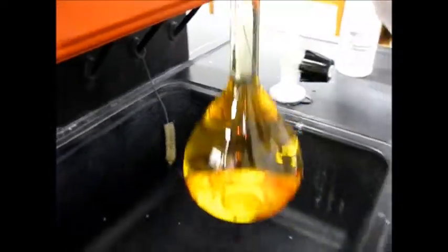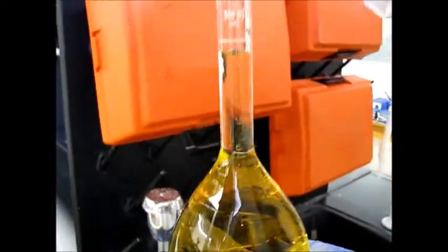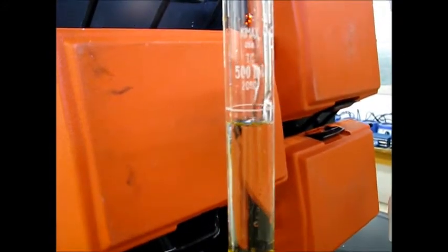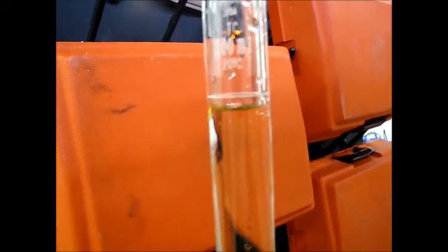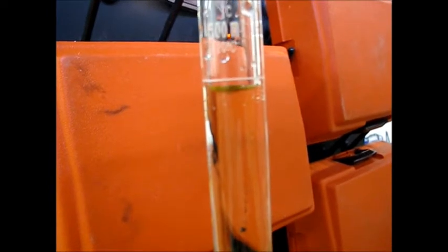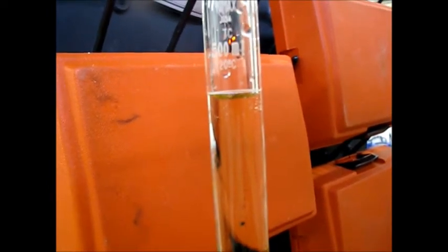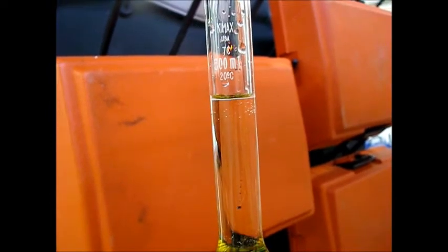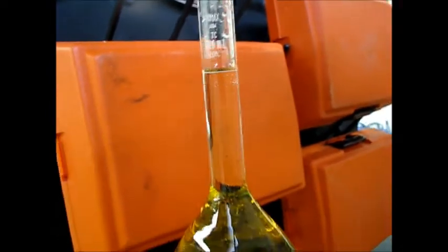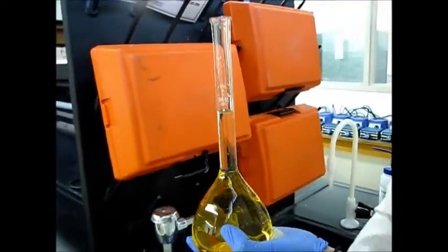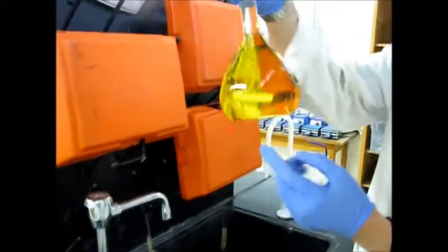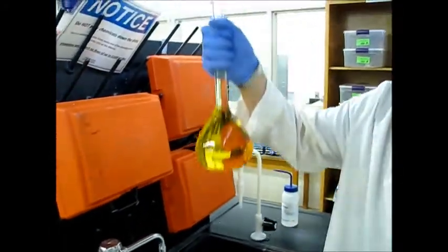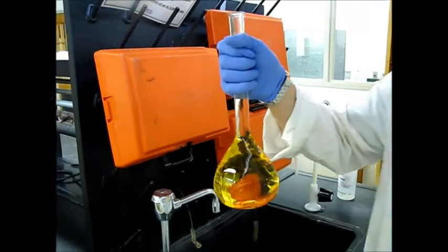So the way I like doing this is having it just below and then being able to kind of really finely just put in the rest with the squirt bottle. And again, you want the bottom of the meniscus, the little dip right there to be right at the line. So a little bit more. And there we go. That's exactly 500.0 milliliters. So we'll put parafilm on here and shake it around to get the solids to dissolve. And then we'll be able to take a spectroscopic reading. So we'll cut ourselves a new square of parafilm.